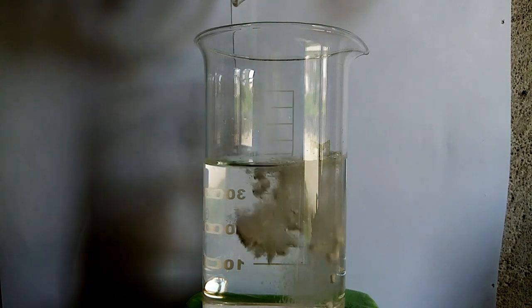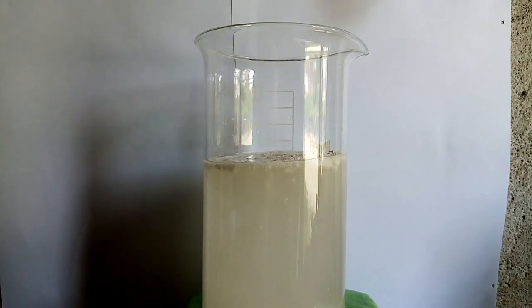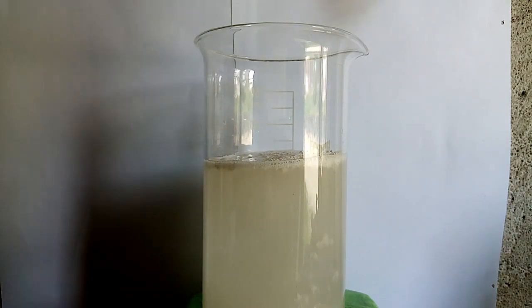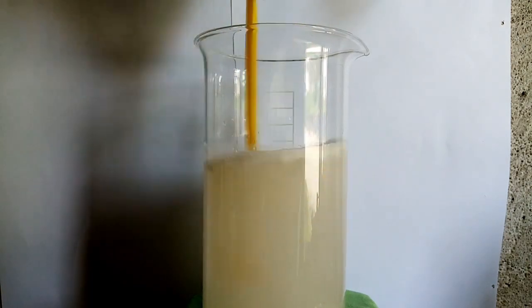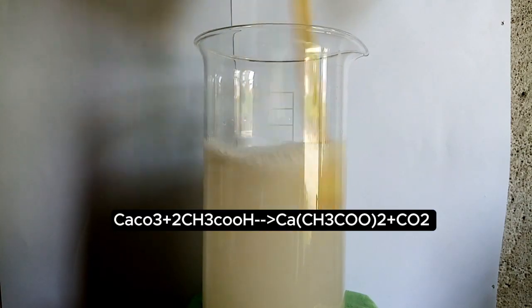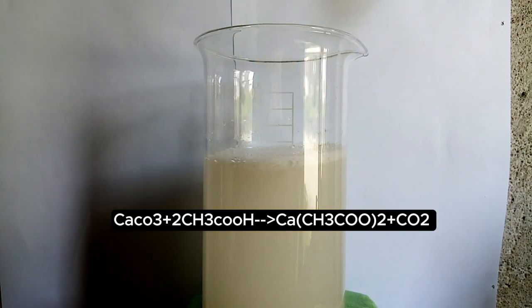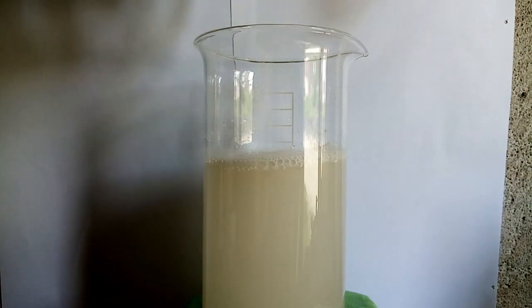After that, I dump in the powder of the calcium carbonate. Do it slowly because the reaction produces a lot of carbon dioxide gas, which will bubble out of the beaker. What is happening here? The calcium carbonate reacts with the acetic acid from the vinegar and produces calcium acetate and carbon dioxide gas.